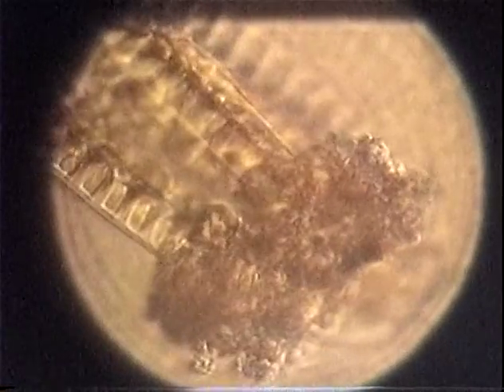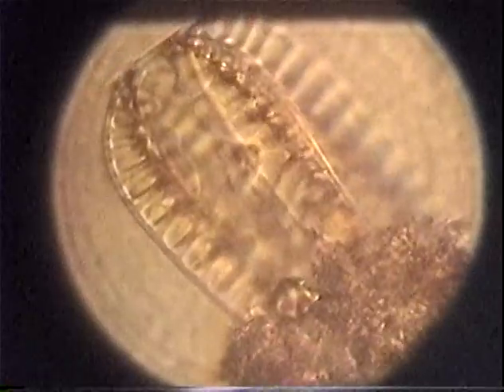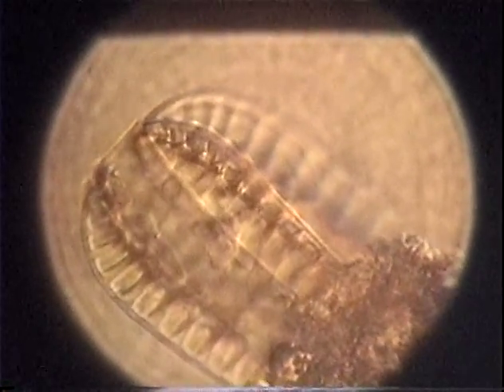It does have a bit of algae stuck to it. Oh, that's so neat. It's like camouflage. Maybe that algae is camouflage. Maybe it's a food supply it's carrying around. And it looks like corn to me. Yeah, it does. Looks like we're looking through a clear piece of corn, and these are the individual worms inside of it. Also, it looks like this is a line of the body that comes up toward us, and it goes around on the backside away from us. Like this? Yeah, it looks like a dome. A tail of a skirt. Yeah, seriously.